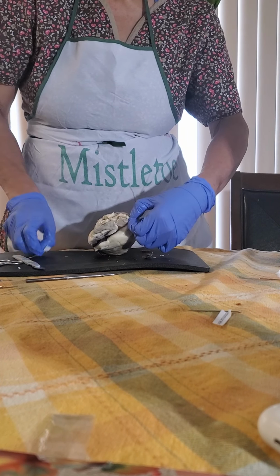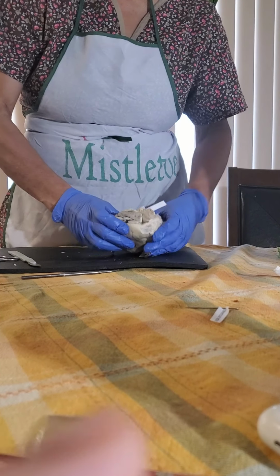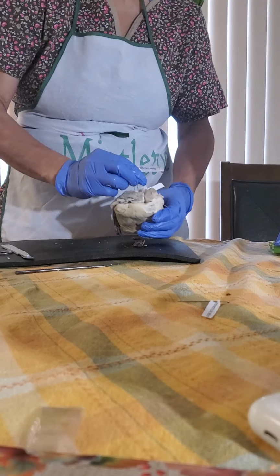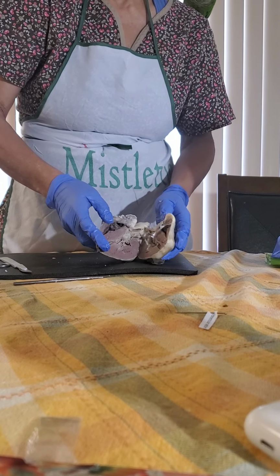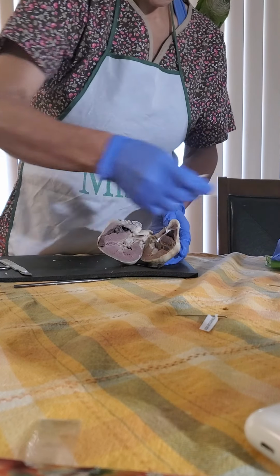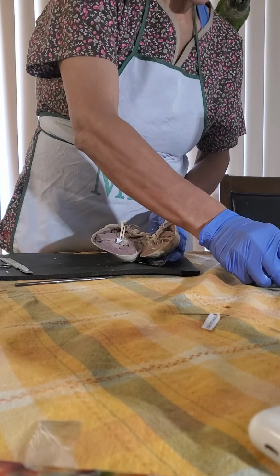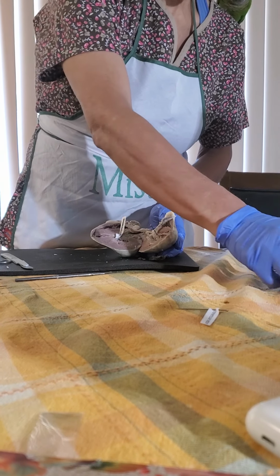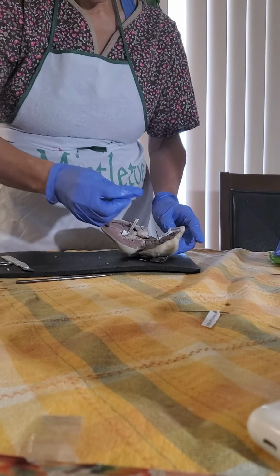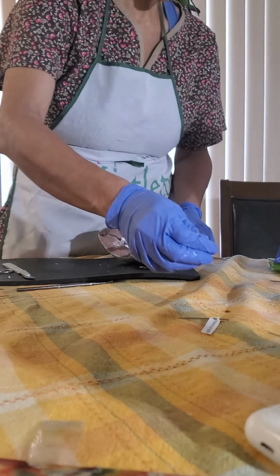So you're going to identify the aorta and the pulmonary veins, which are in the back of the heart, and I want to be sure that you take a look at the chordae tendineae, and as well the papillary muscles, which are right here, so you can appreciate it right there.